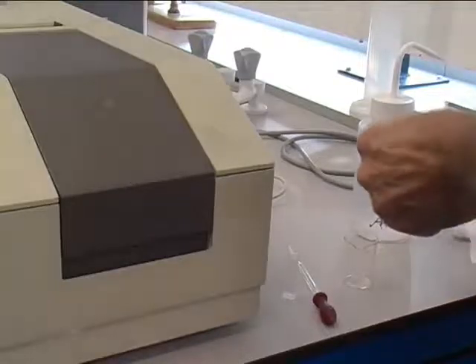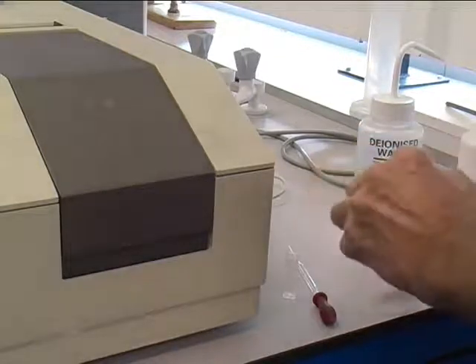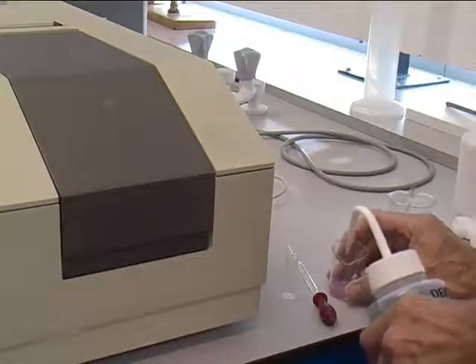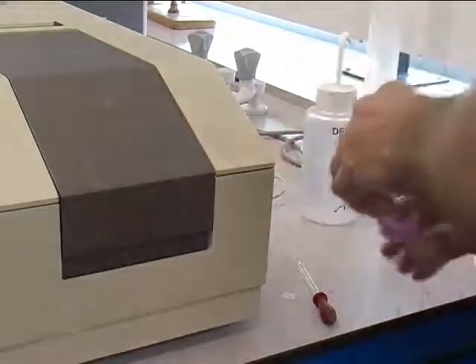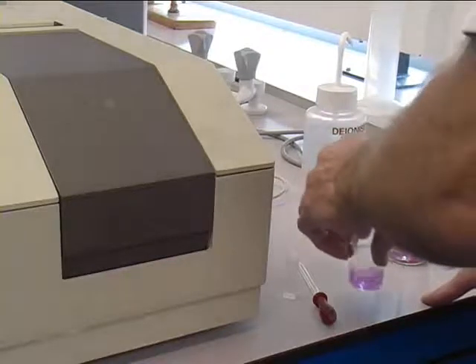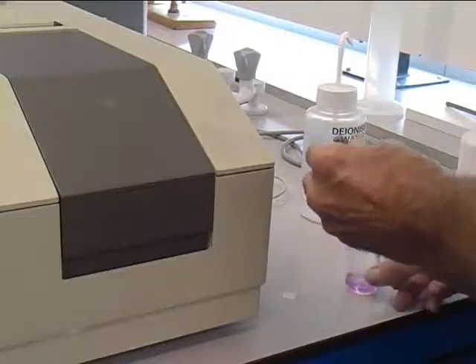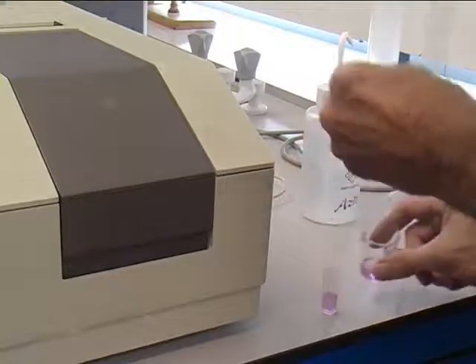To run your sample, take a small part of your sample — typically the end of a spatula — place into a beaker and dissolve in deionised water. Then, using a pipette, transfer your sample into the cuvette, leaving about one centimetre from the top. It is important not to overfill it.